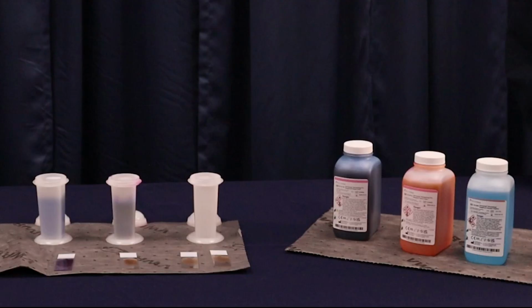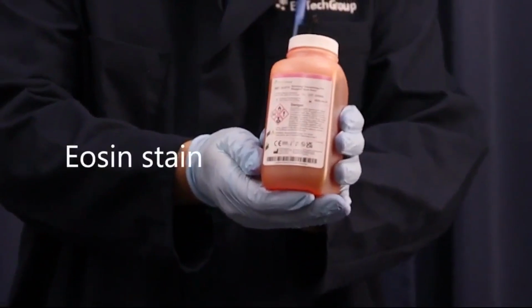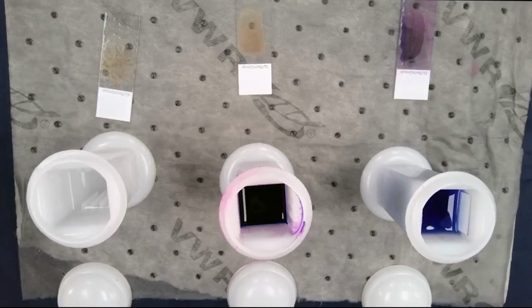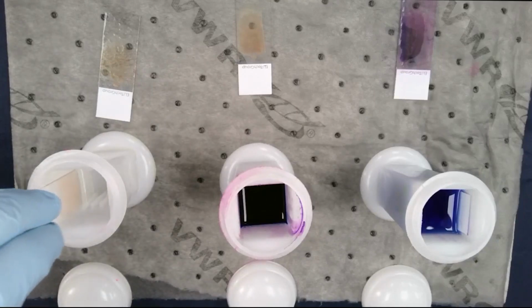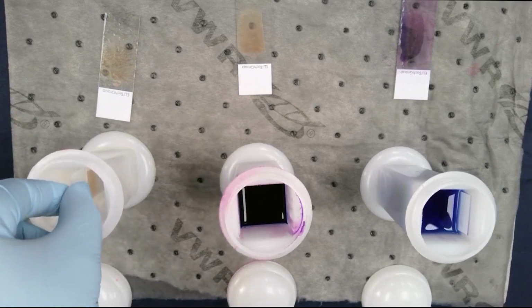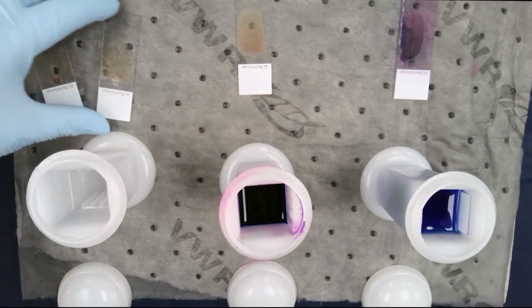Here's an example hand staining setup for blood smears. One can use ELITech's Aerofix as a fixative, the red dye eosin, and finally the blue thiazine dye for staining. Here's a top-down view of the staining setup. The first thing we're going to do is place the blood smear into the fixative, which we've decided to go with absolute methanol for. Most protocols require only a single dip or few seconds in the methanol for fixation.